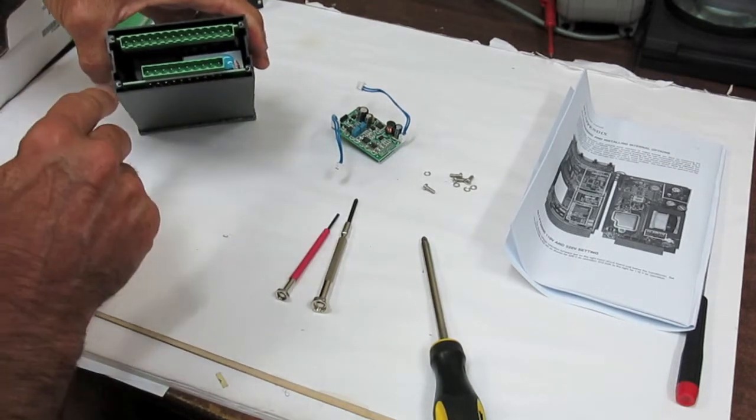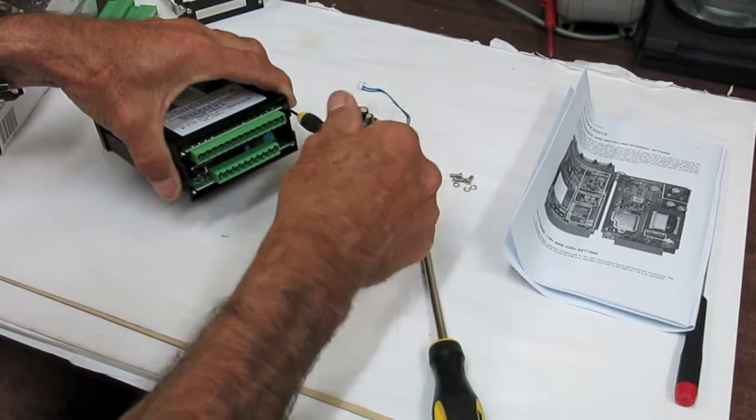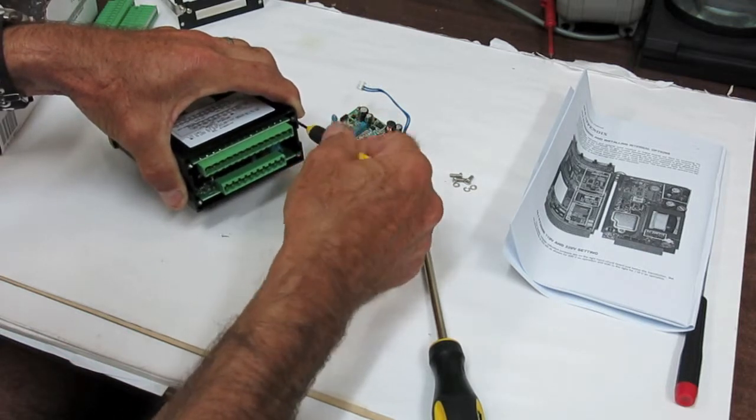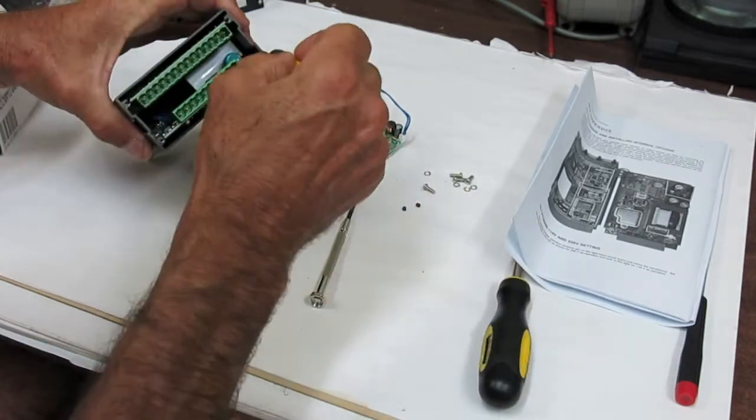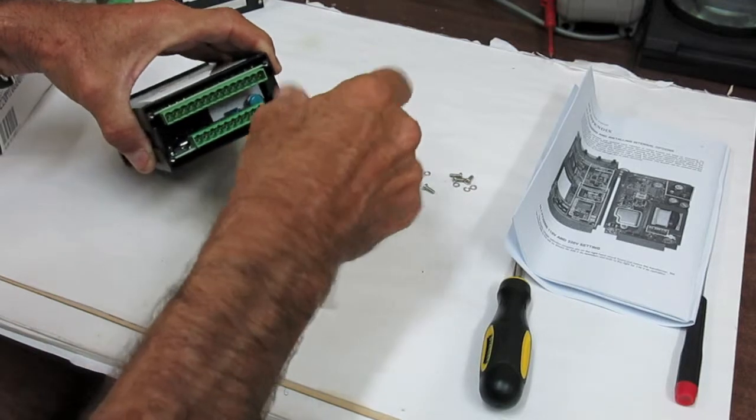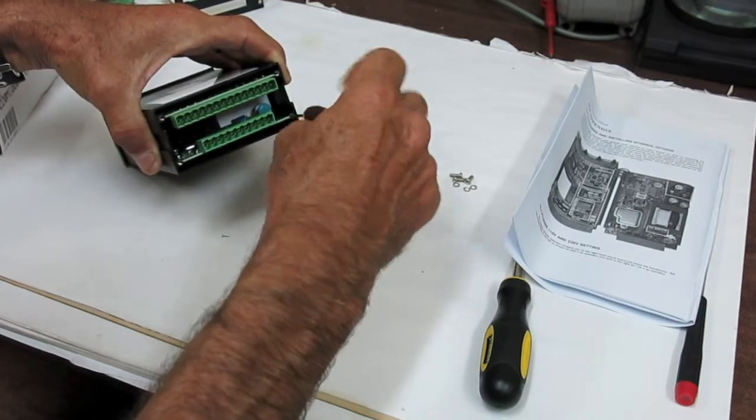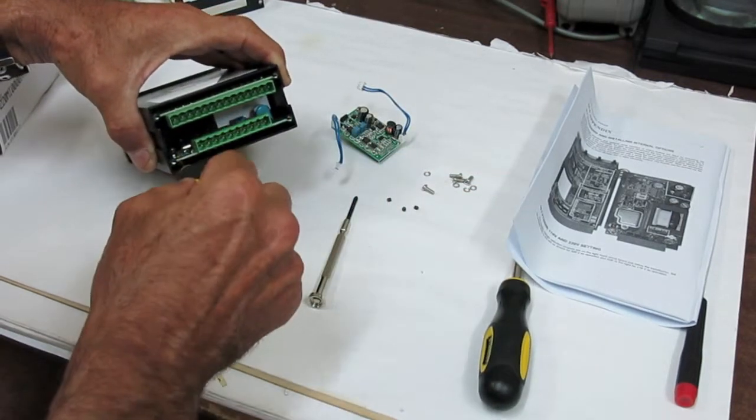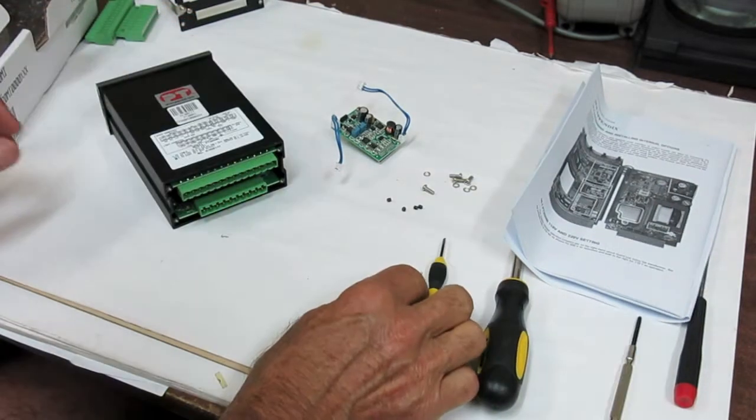Remove four screws. Four screws removed.